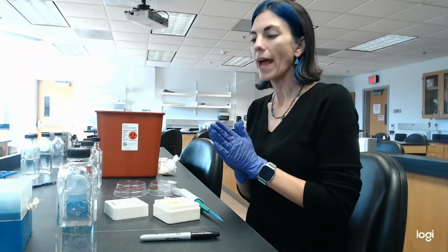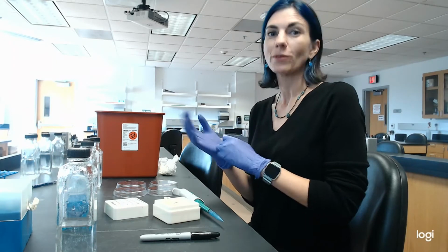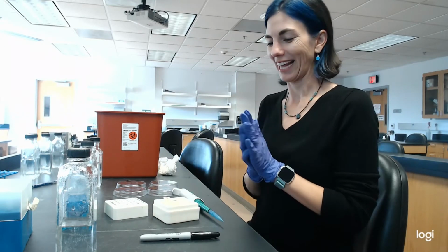Okay, so I collected my saliva. Super glad I did not put that on camera. I just had lunch. It was really chunky, and I had cheese. As you can probably see, there's a little bit of color and some floaters in there.